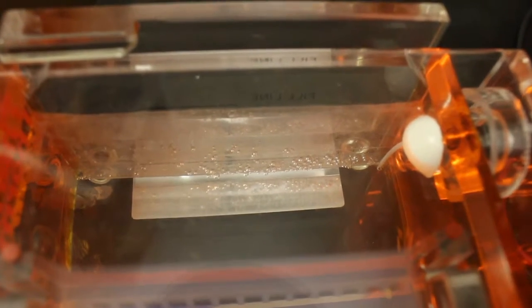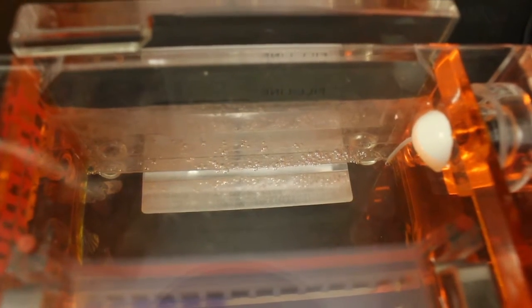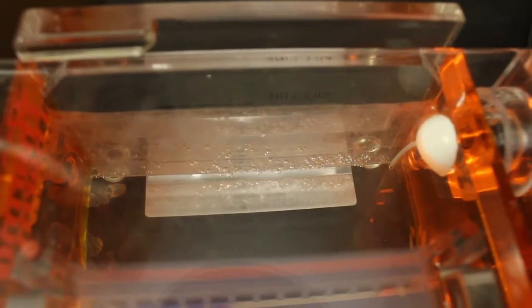You can ensure that the chamber is conducting electricity by checking for the presence of bubbles around the cathode and the anode.